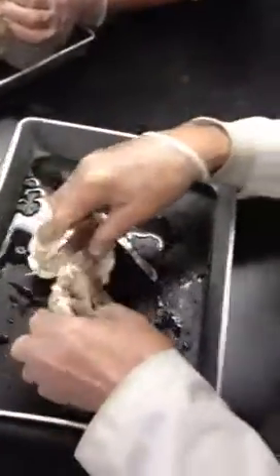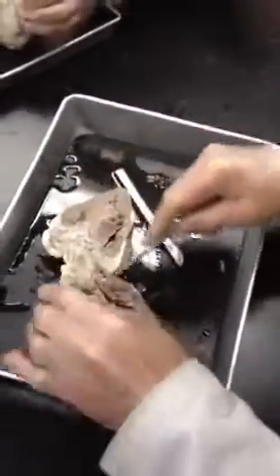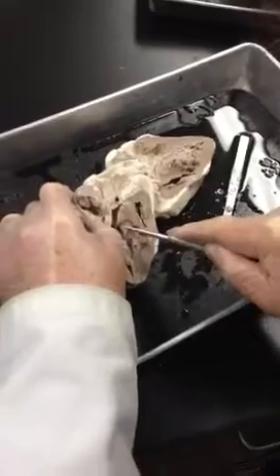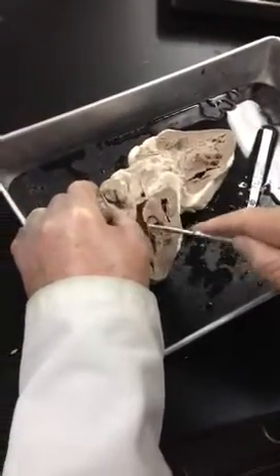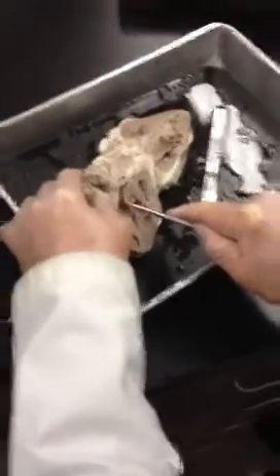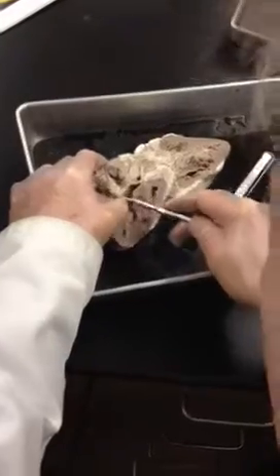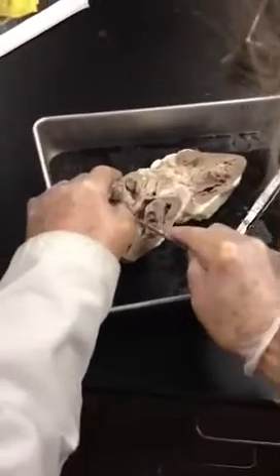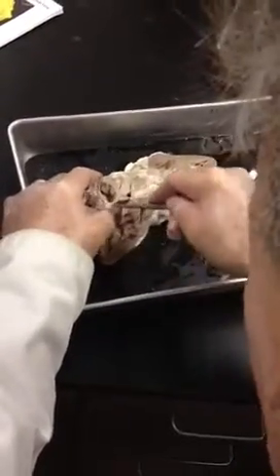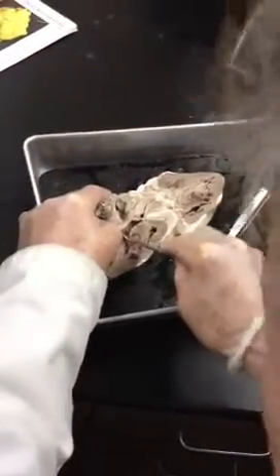Right about here, if this is the superior vena cava, then this should be the tricuspid valve. You're going to see three cusps — so each of these is attached by the chordae tendineae to three cusps. There's one here, two here, and one behind — three total.